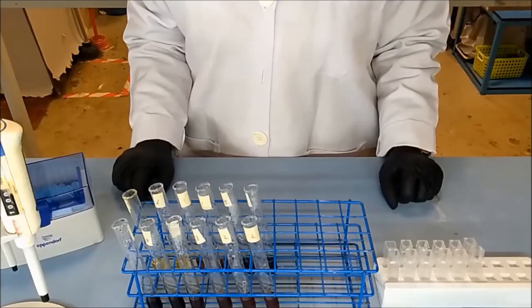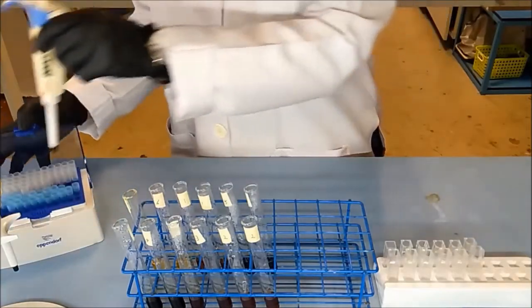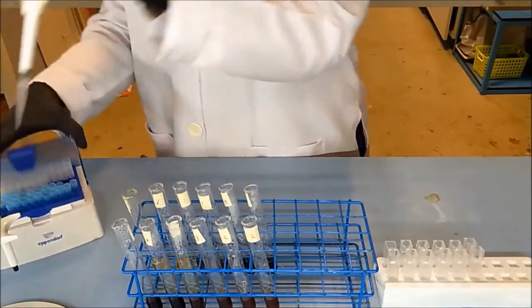Next, transfer 2 mL of each sample into a clean and clear cuvette.